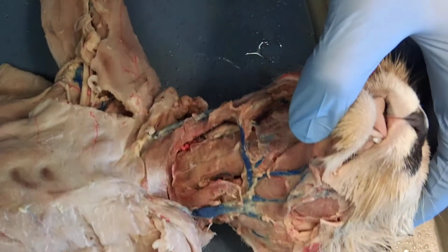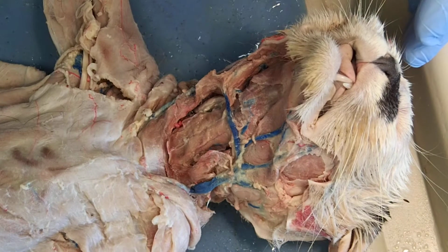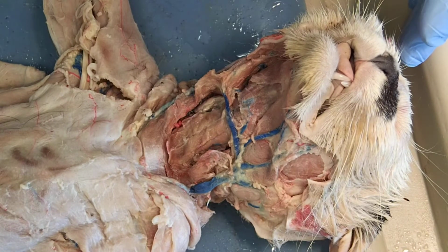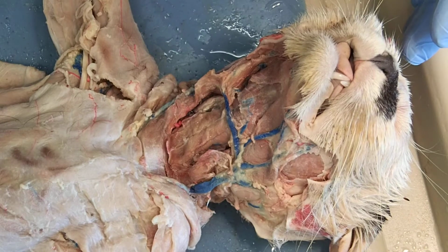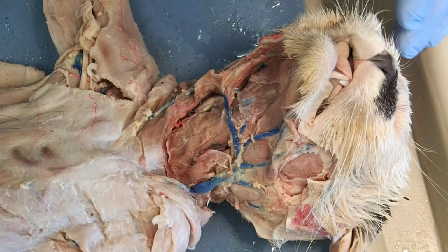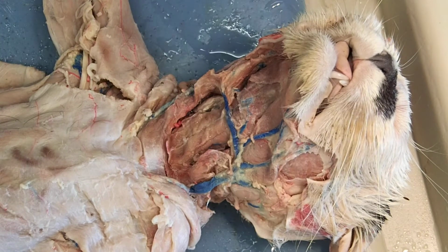All right, welcome to another fun-filled adventure of Comparative Vertebrate Anatomy Lab. Today we're going to be looking at part 2, the muscles of the throat and jaw. I'm going to show you some stuff up on the board in a little bit, but I wanted to show you some of the muscles right now. And then we'll go up to the board and we'll take a look at some of the patterns that we see with these muscles.